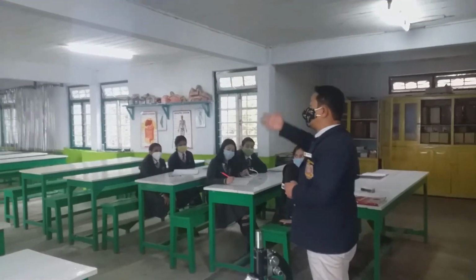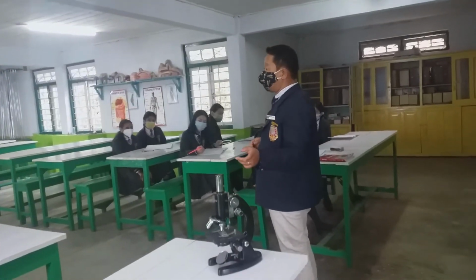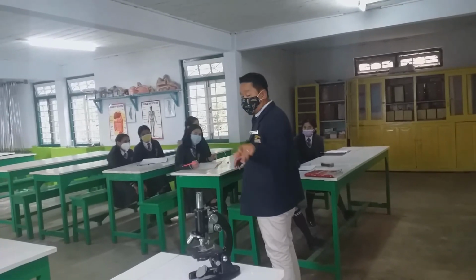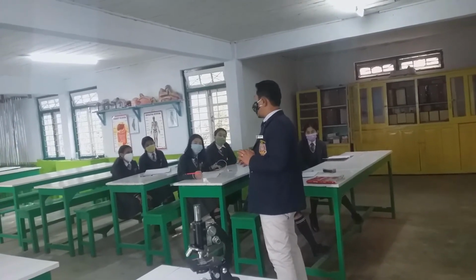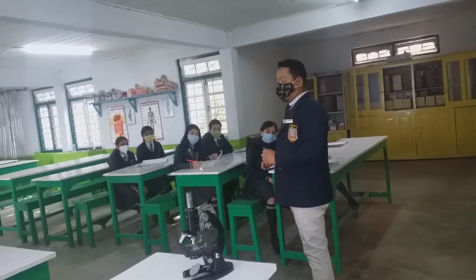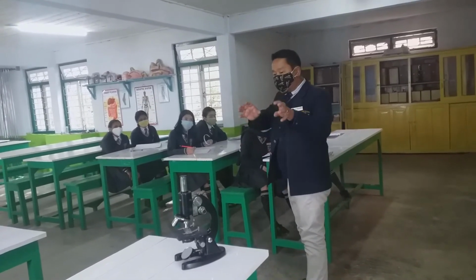As you go to the college level, you have to prepare the slides by yourself. There are two types of slides we make, temporary and permanent. This is your permanent slide, which we can use afterwards also. You can preserve it for many years. Today, because of lack of time and due to some technical tricks, I have already adjusted it and made you see it under the microscope.